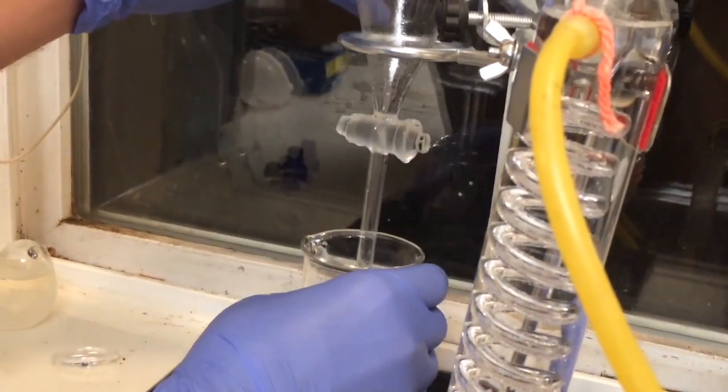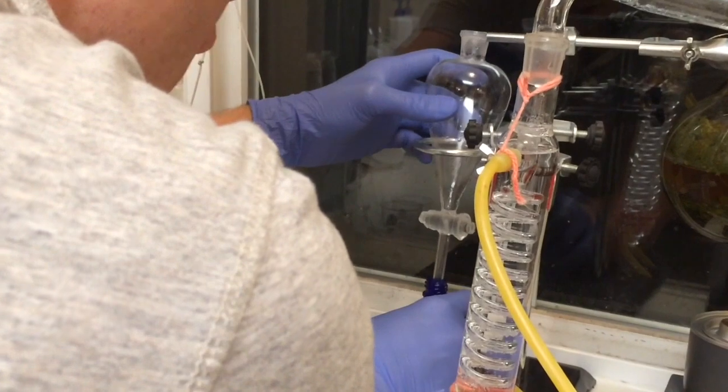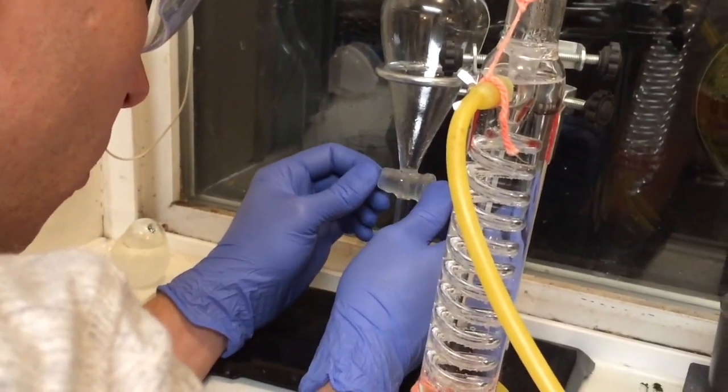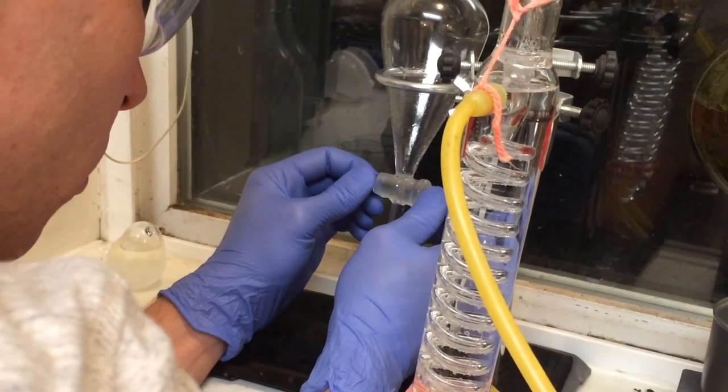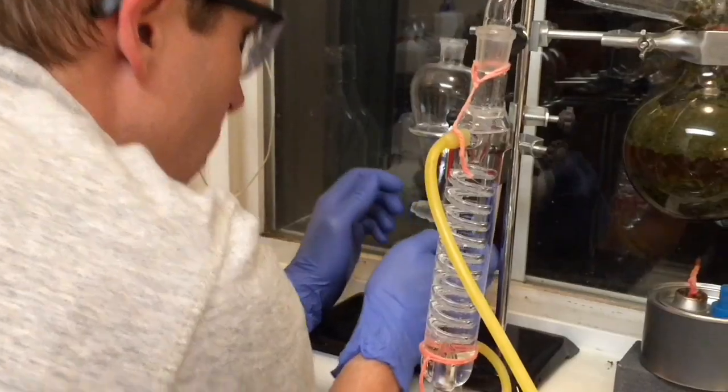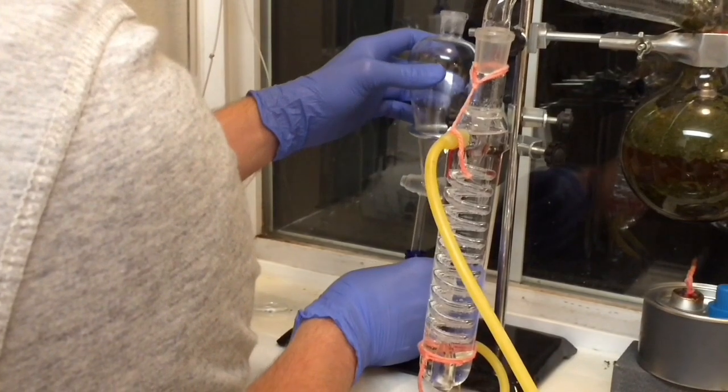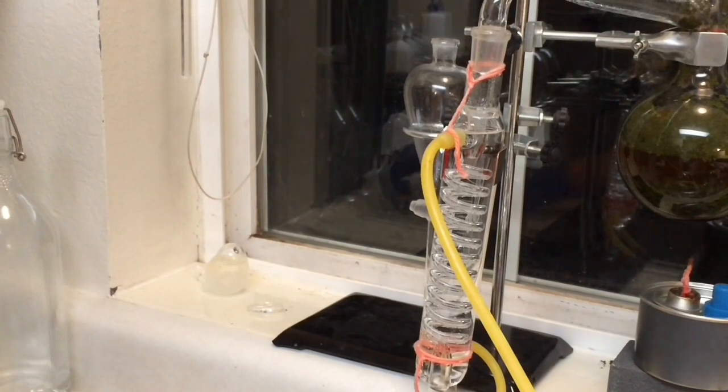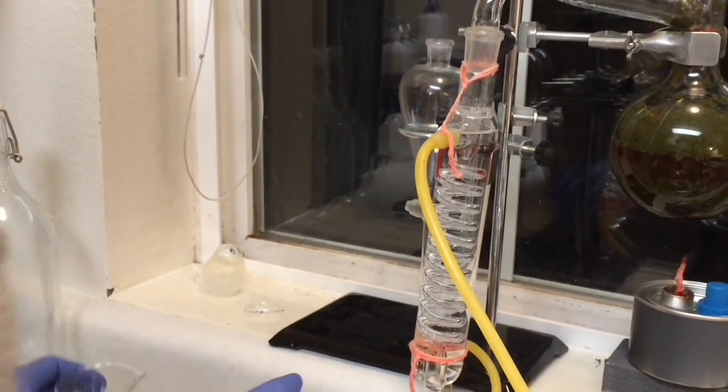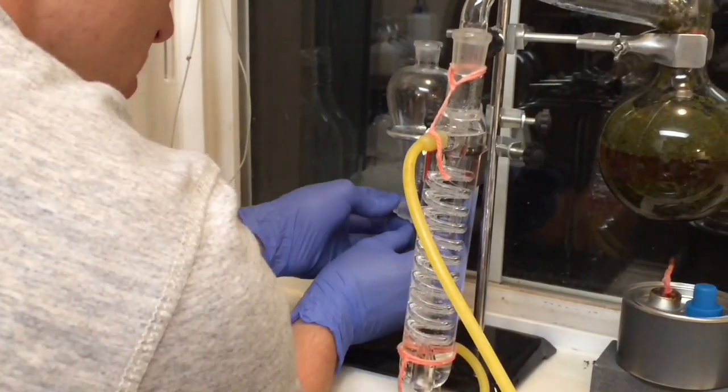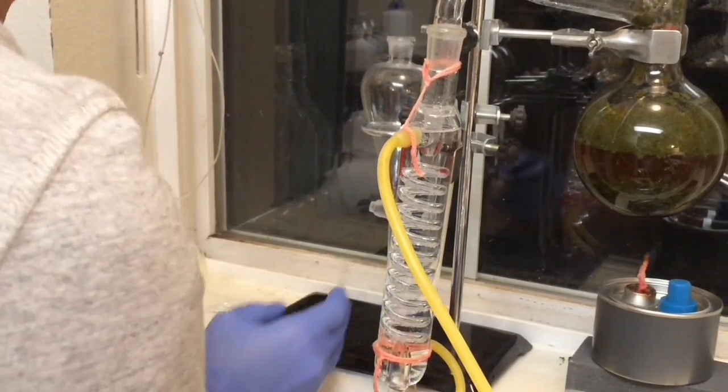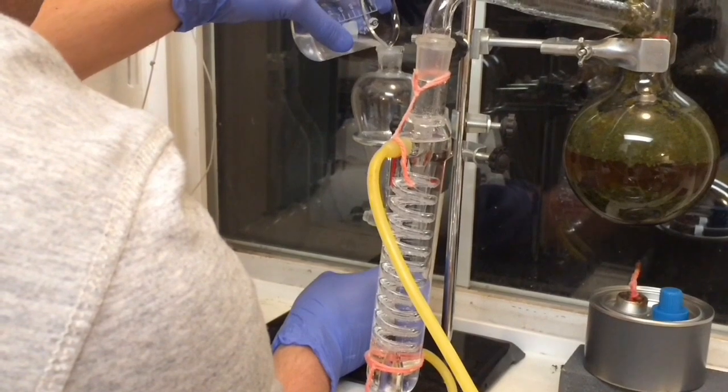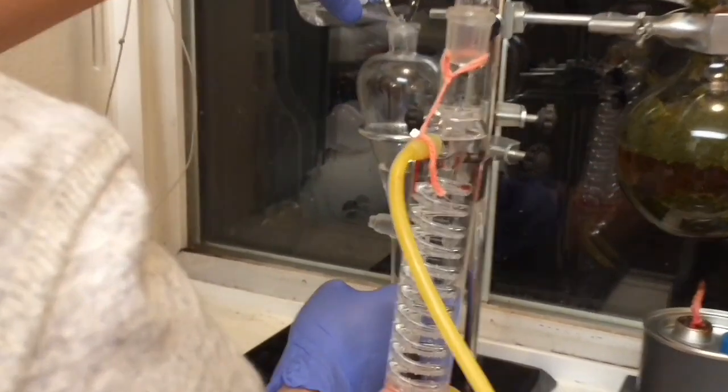I'm going to remove this. And in the morning, since it's getting late, I'll go through and right now I'm just going to pour my hydrosol back in my separating flask and let that sit overnight and collect the oil. And then I'll repeat the same process again.